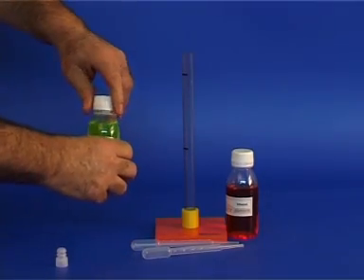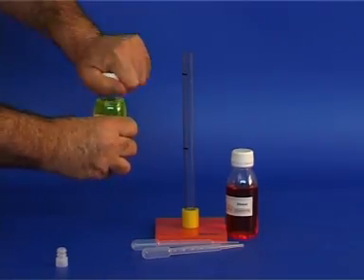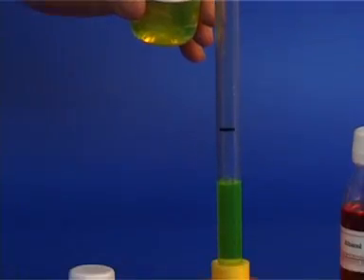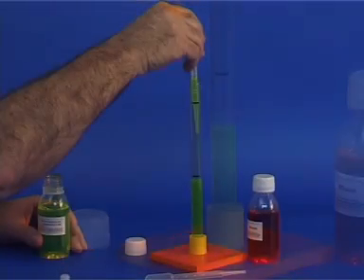Let us take the heavier liquid, water, and fill the tube up to the first mark using a dropper. Use the dropper to slowly fill the last portion.